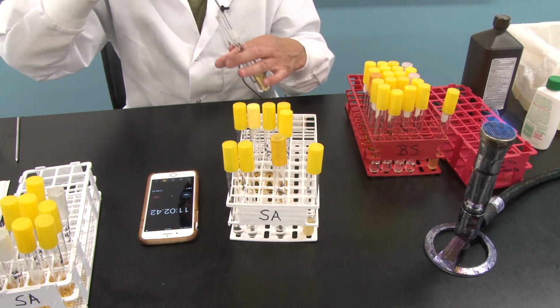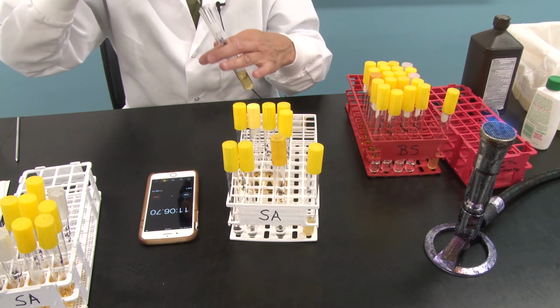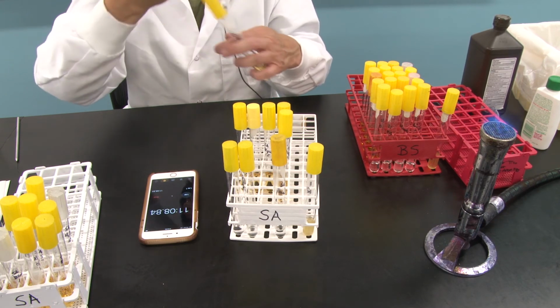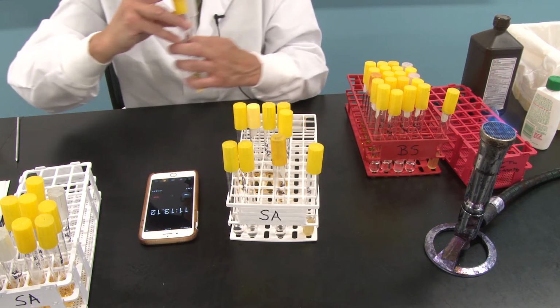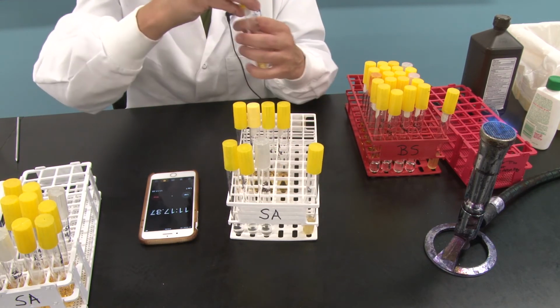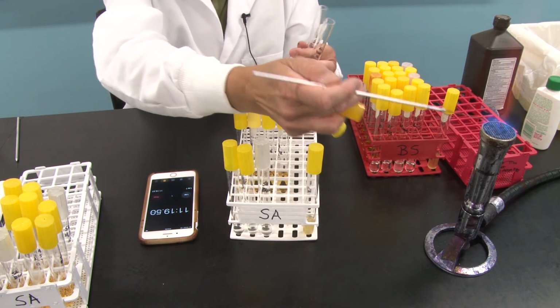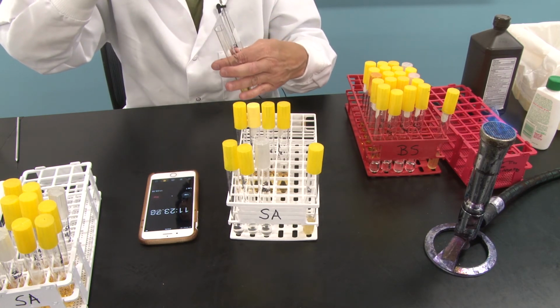As we move them out of the bleach and into good complex medium, if they survived the bleach exposure, they will grow in that medium. And that is our goal, to see if that is the case. Okay, and finally the Bactine. Loop is flamed. Grab a loopful of Bactine.